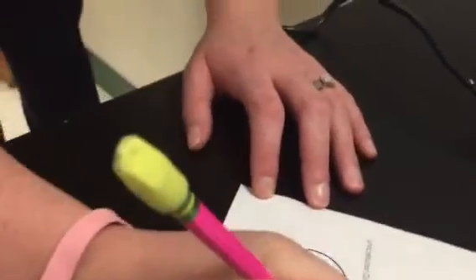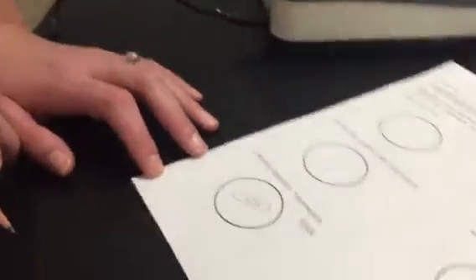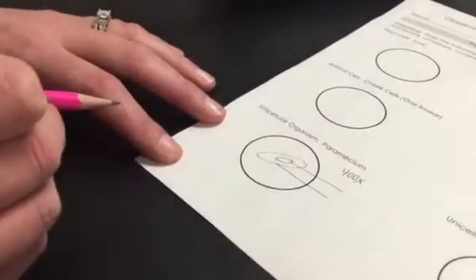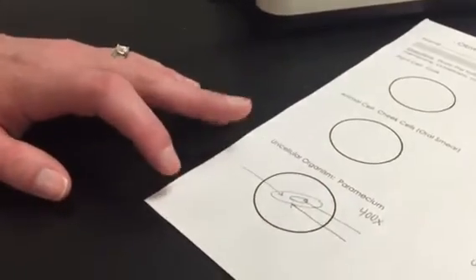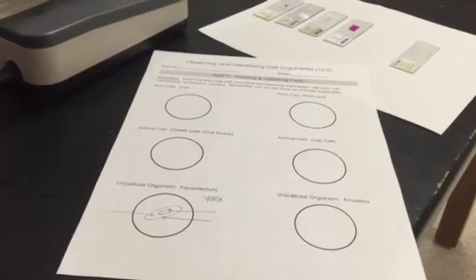But speaking of detail, you're probably going to want to write down that I'm looking and drawing this at 400 times magnification. And then I'm also going to label my diagram. So right here, I'm going to label something, and right here, I'm going to label something. And even probably right here, I'm going to label something. So there are 3 things that I'm going to label on this diagram, remembering that these 3 things that I see are one of the organelles in that list above. You're going to do the same thing. You're going to draw and label each of the other 5 cells.